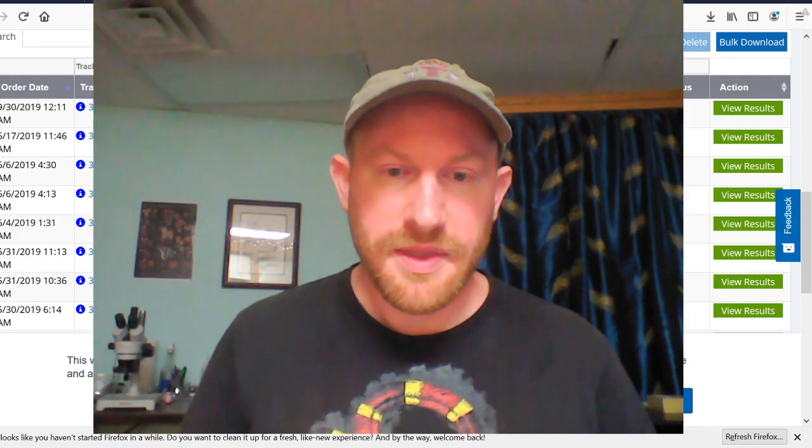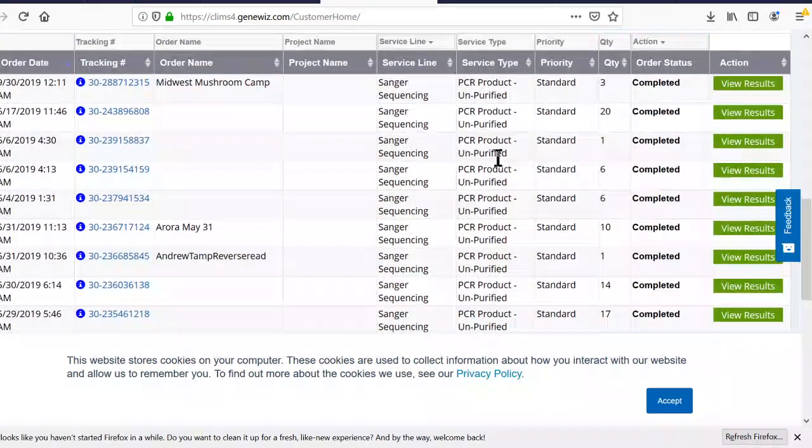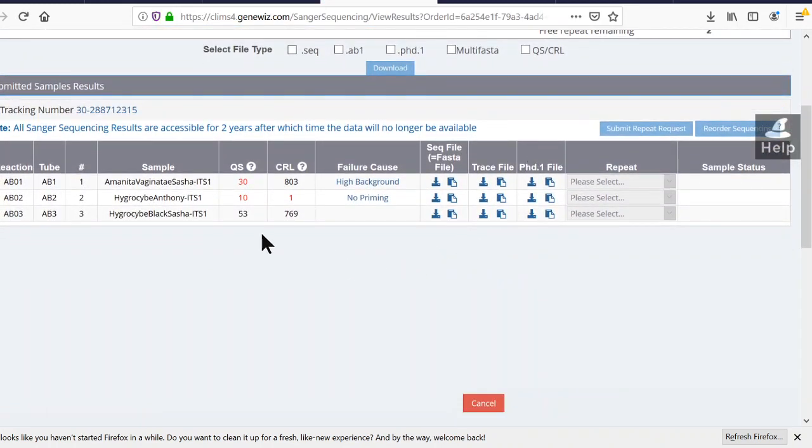So to start, here's the GeneWiz site. And so you can download, here's the different sequencing runs that I have. And if we view the results on a sequencing run, here's the three sequences I have. And you can either get an SEQ file or a trace file. Now the SEQ file is just a text file that has the sequence that's been decoded in it. So what we want to do is get the trace. And the trace is called a chromatogram. And we will open up the trace with SnapGene Viewer.